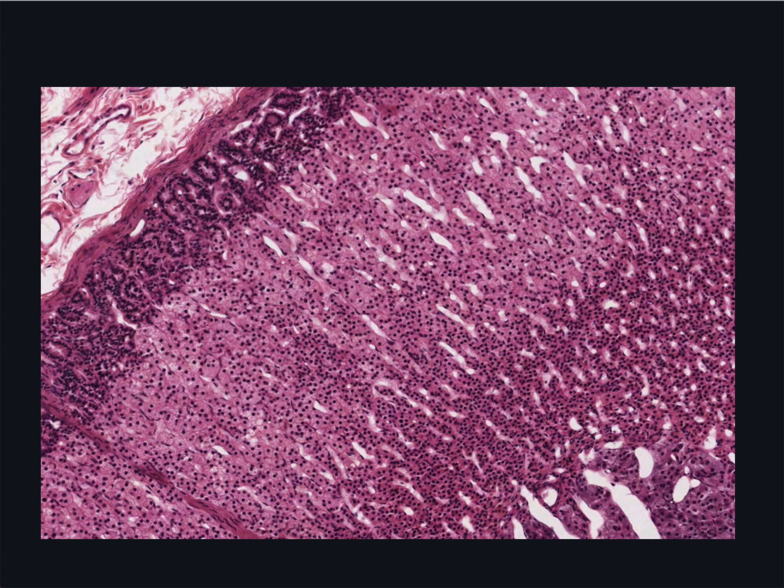The layers also differ in the appearance of the cells. The cells of the middle layer, the zona fasciculata, are largest and much paler. The cytoplasm of these cells looks very foamy. This is because the numerous droplets of steroid hormone precursor, or lipid droplets, which fill their cytoplasm, become leached out during slide preparation. The cells of the two adjacent zones look much darker.